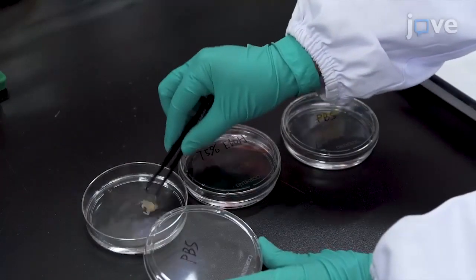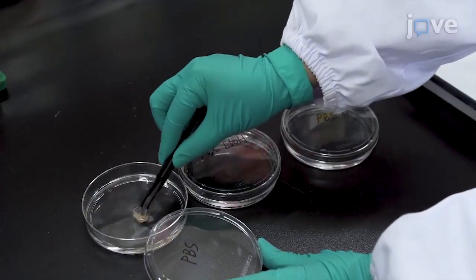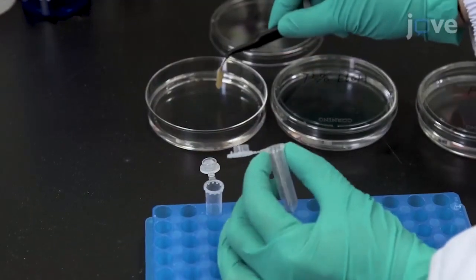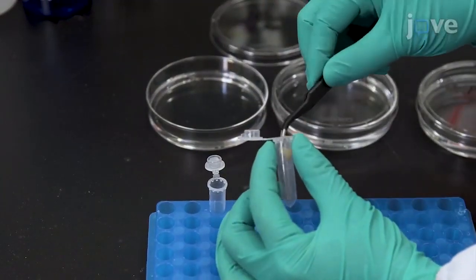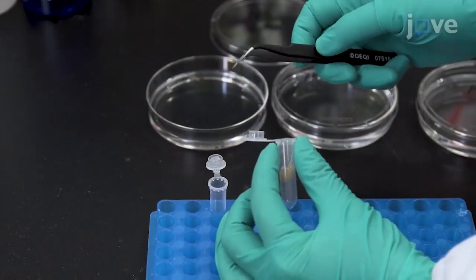Then wash the tissue samples in PBS three times to remove the ethanol and transfer about 100 mg of tissue sample into a 2 ml sterile microcentrifuge tube.